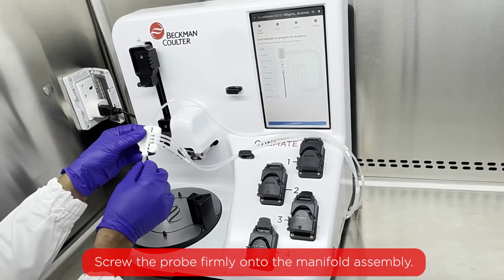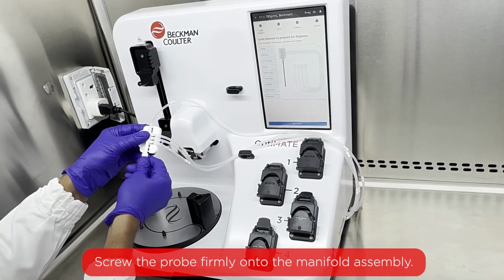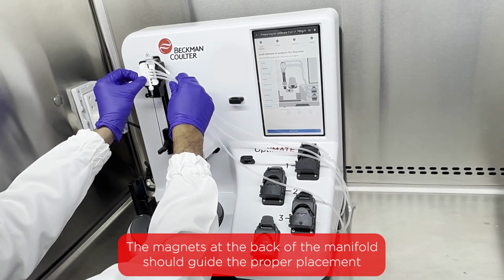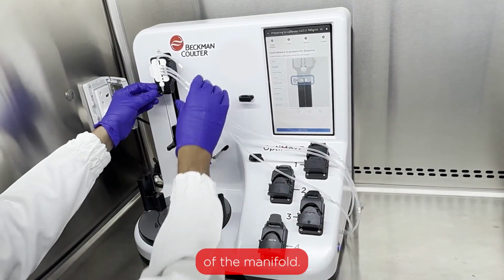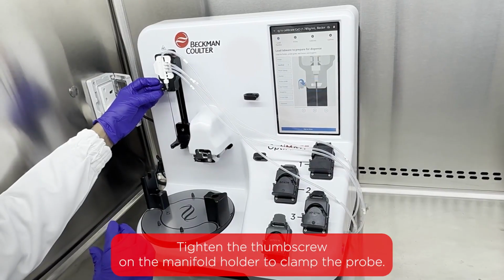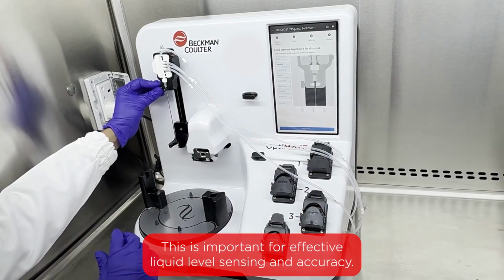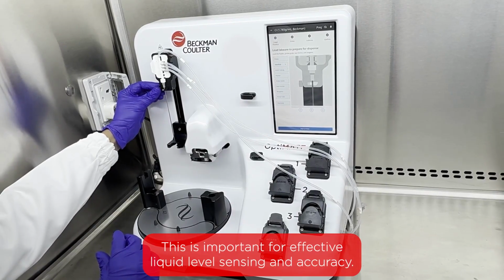Screw the probe firmly onto the manifold assembly. Install the manifold. The magnets at the back of the manifold should guide the proper placement of the manifold. Tighten the thumb screw on the manifold holder to clamp the probe. This is important for effective liquid level sensing and accuracy.